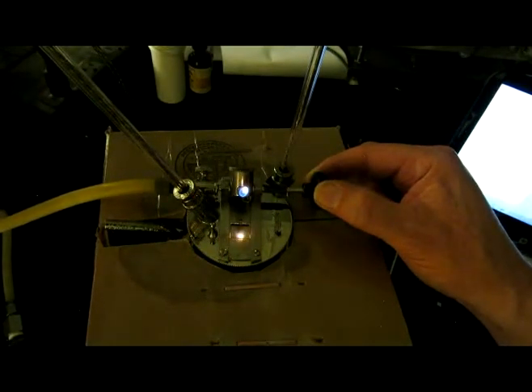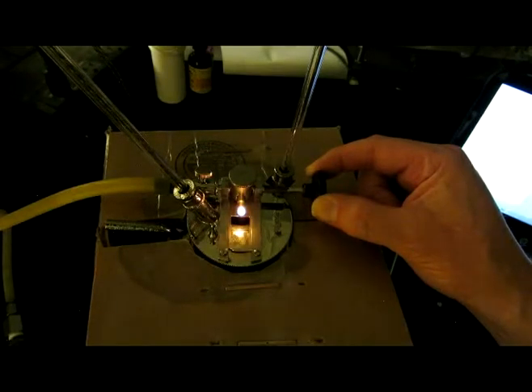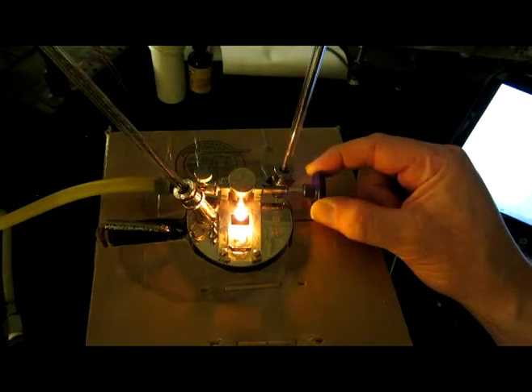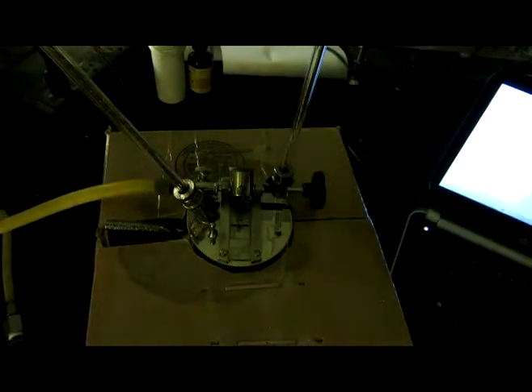When I bring it up, there's just a little bead of blue with just a touch of yellow. As I bring it closer, the n-Propyl bromide vapors are burning right here. You can see the flame enhancing, but it's just burning of the vapors from the flame itself. Take it away and it extinguishes itself. Go closer. The vapors are burning. I don't know if you can see it on the video, but there's a greenish tint to the flame. If I go all the way in, it went out.